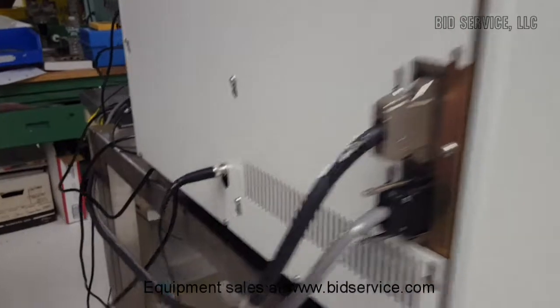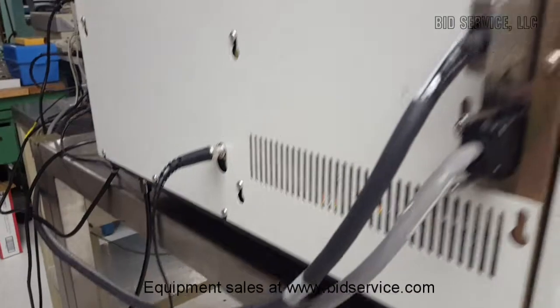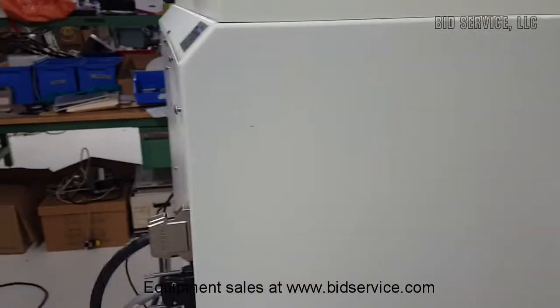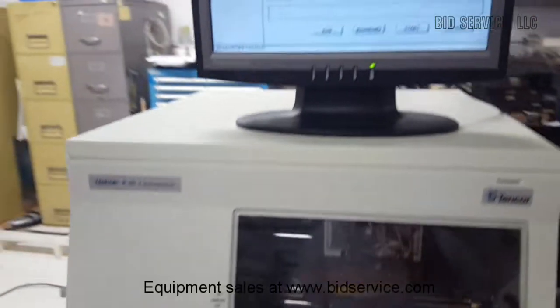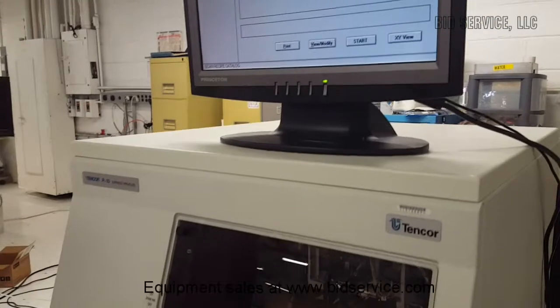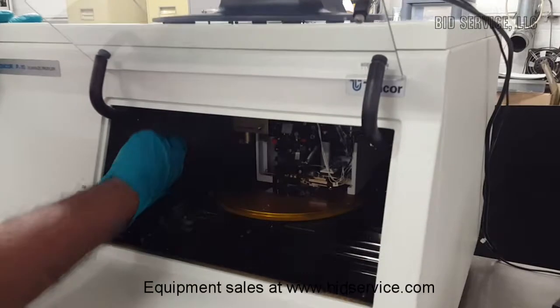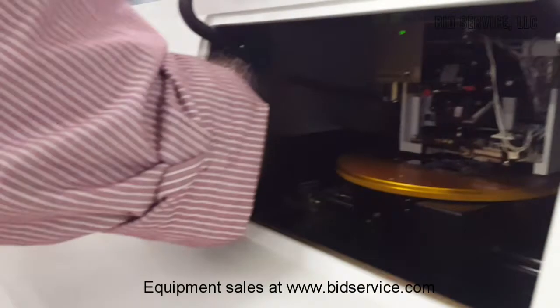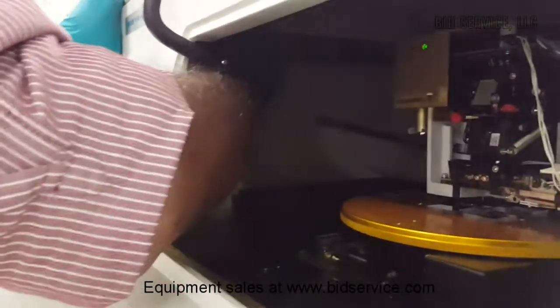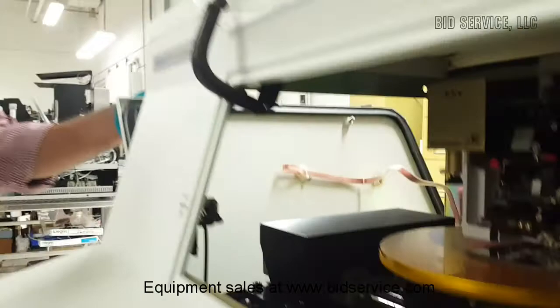This is the vacuum connection here. So if you turn on the vacuum, the vacuum pump can be connected, and the system will be shipped with the shipping brackets on the tower, and I will explain to you how to access those shipping brackets. So you have to reach for two knobs like this on this left-hand side panel of this machine. And I'm going to give a bird's-eye view of the system from the left-hand side.